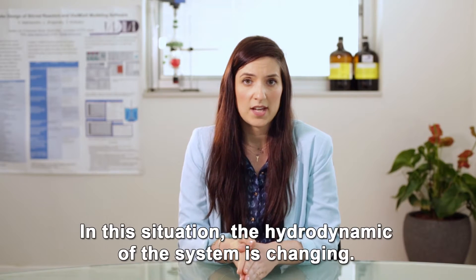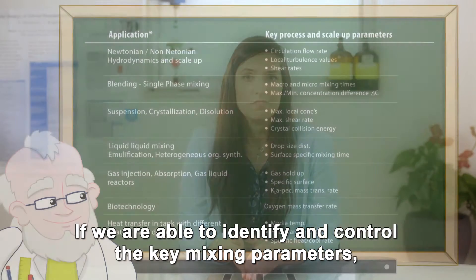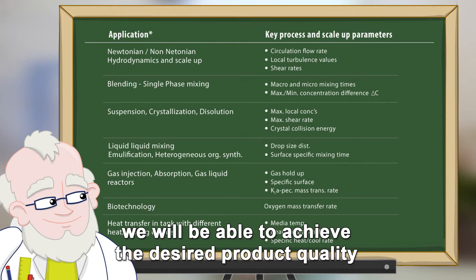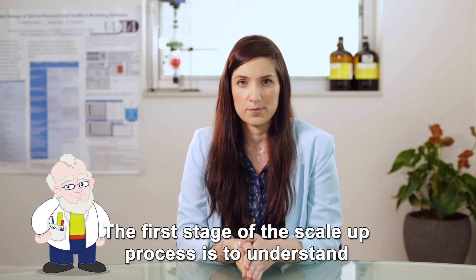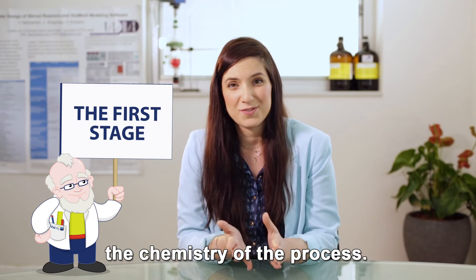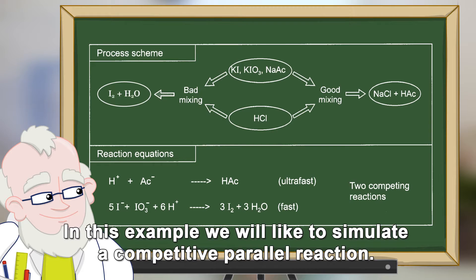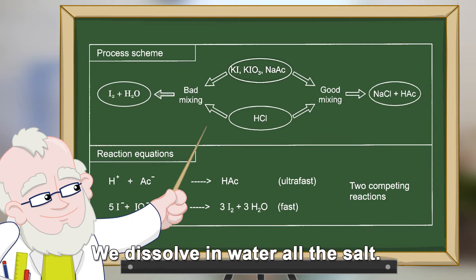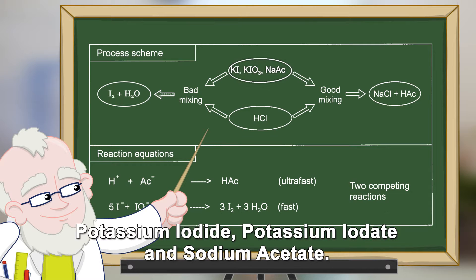In this situation, the hydrodynamics of the system is changing. If we are able to identify and control the key mixing parameters, we will be able to achieve the desired product quality and find an optimal solution. The first stage of the scale-up process is to understand the chemistry of the process. In this example, we would like to simulate a competitive parallel reaction. We dissolve in water all the salts: potassium iodide, potassium iodate and sodium acetate.